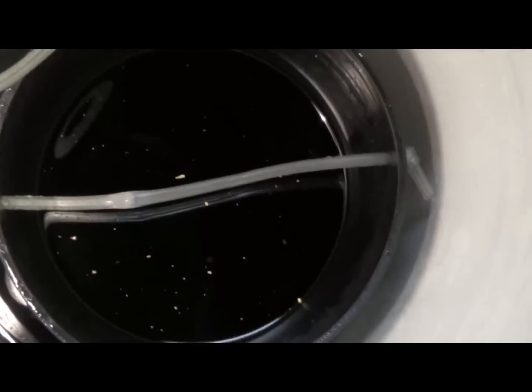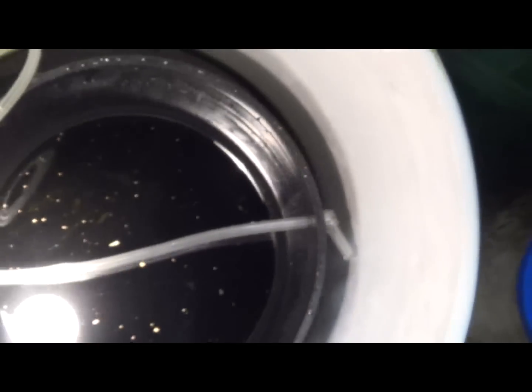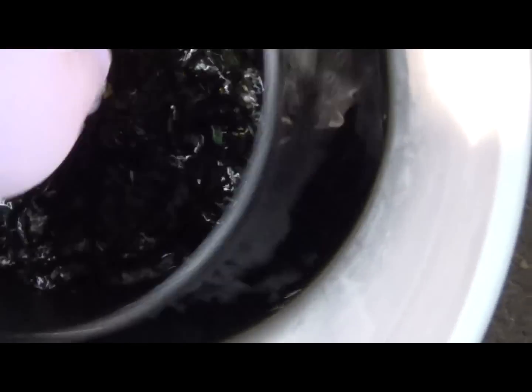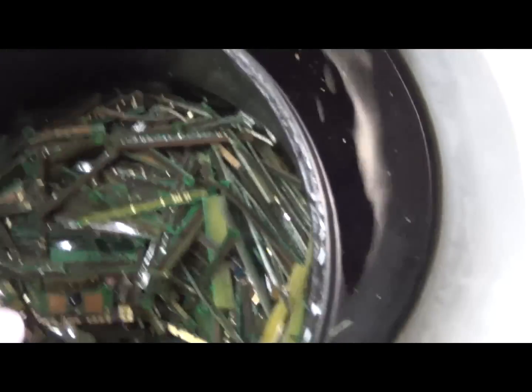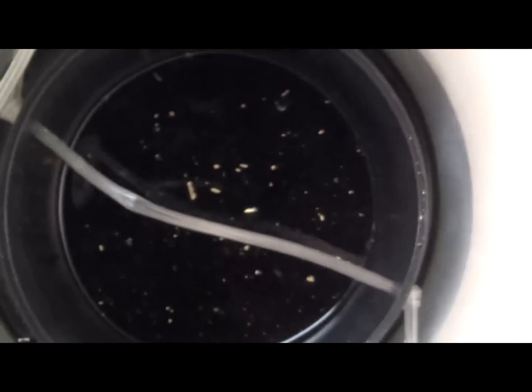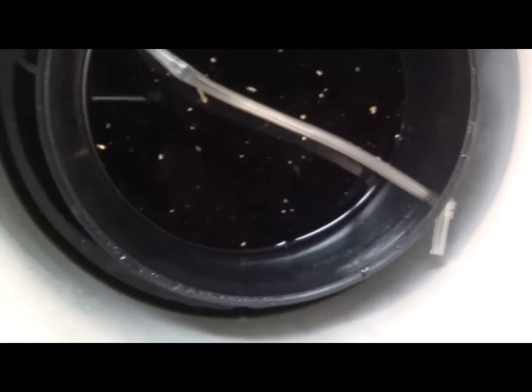Today is Wednesday. Let's take a look — it's getting nice and dark, a nice emerald green color. You can see some splashing up against the wall. Let's shake things up a little bit. Oh yeah, look at that — they're almost all cleaned off! This air bubbler system is great. You can see all those gold foils floating around — it's like the world's most beautiful snow globe.